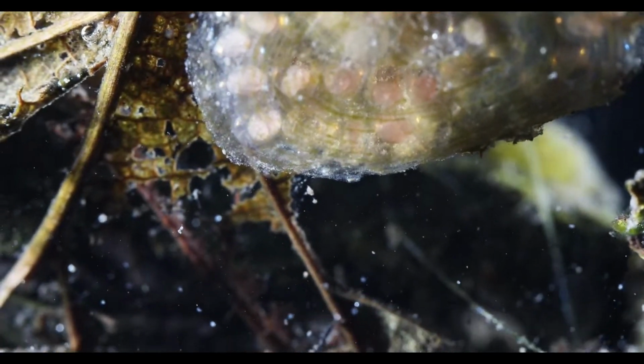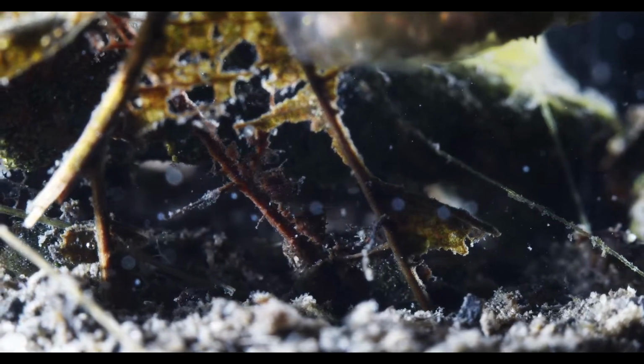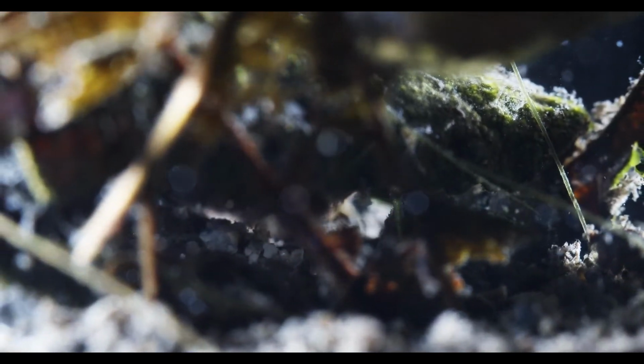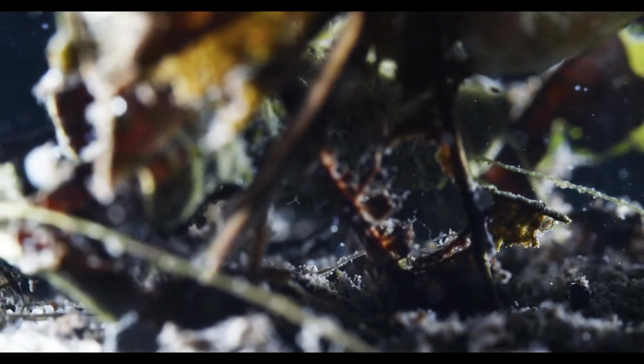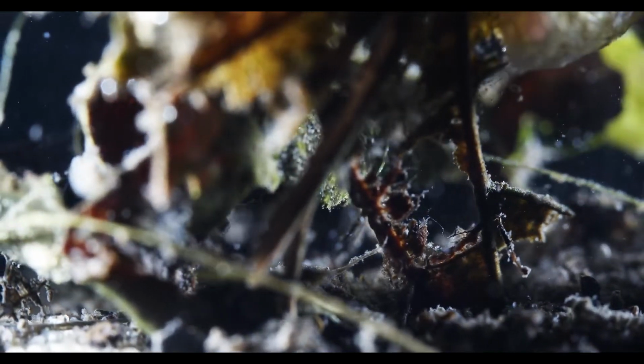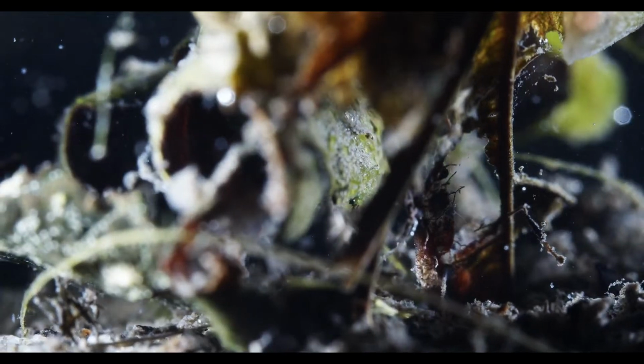But yeah, I wanted to do a stream where I actually get to talk about the critters, because the first two streams were really just testing around with bit rates and all these things to get the quality right, or as good as I can get it with my internet connection right now.